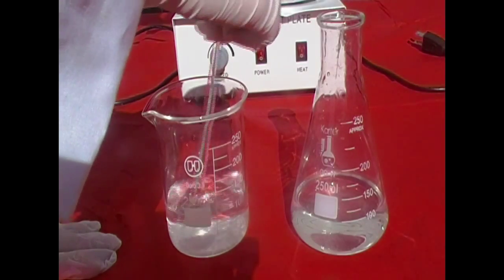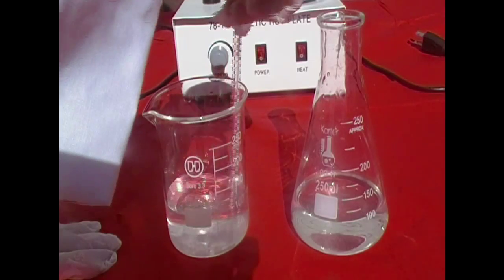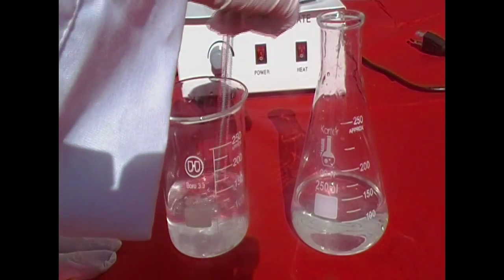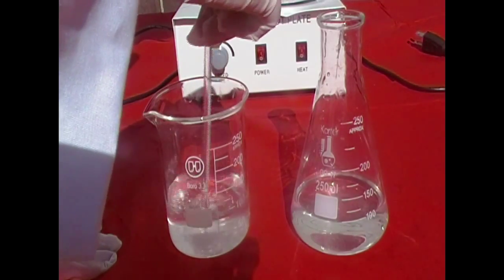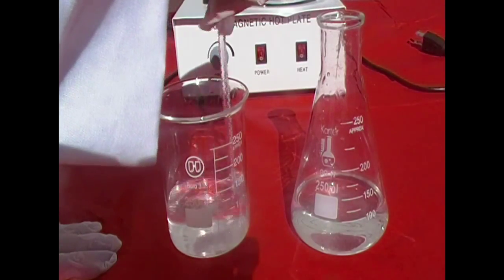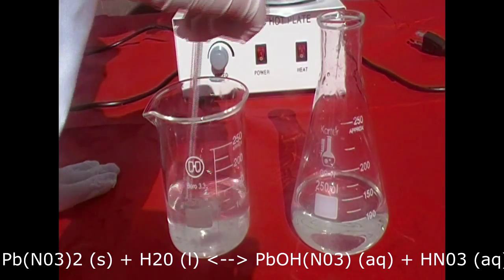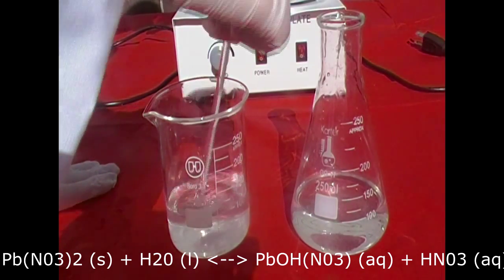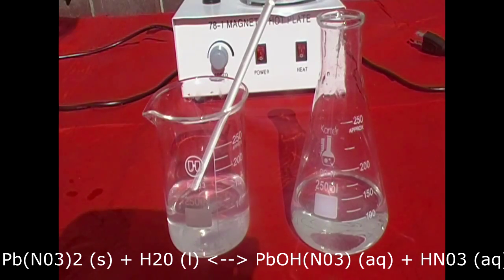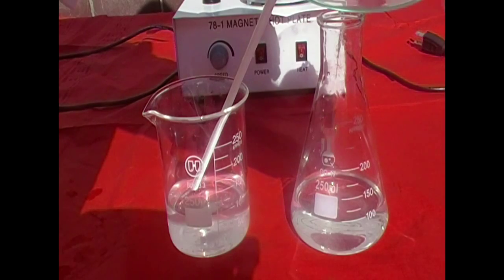You'll start to notice as we dissolve the lead nitrate into the water, the solution becomes cloudy. Now this is due to a process known as hydrolysis. Now I'm going to show you this process in a minute. The hydrolysis is going to really mess up our reaction. So in order to fix this, we're going to have to add a bit of dilute acetic acid, or basically just vinegar. Now once it becomes clear, we're ready to dissolve our potassium iodide into the other flask.